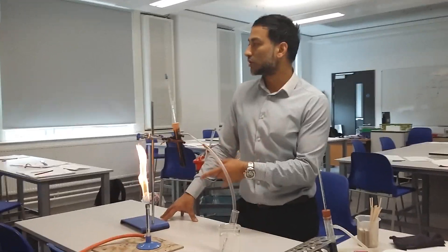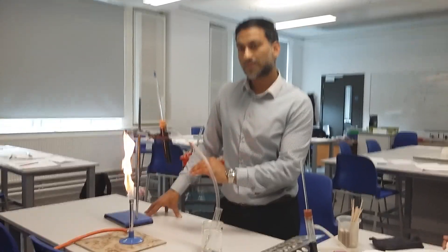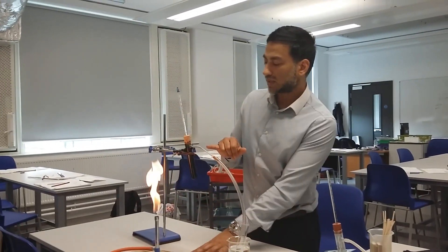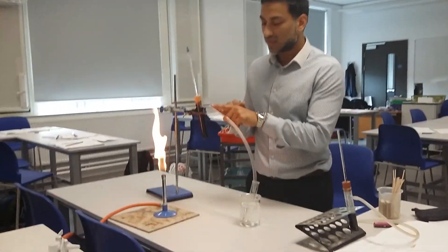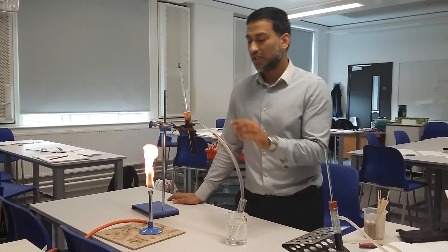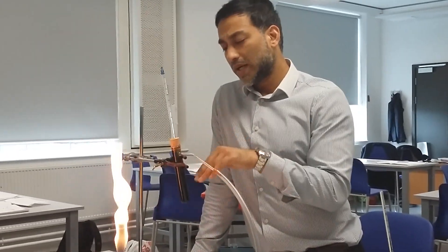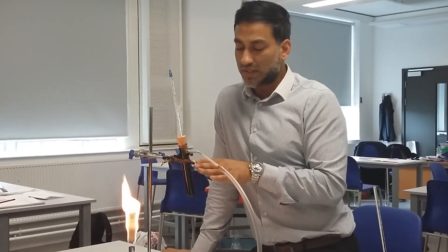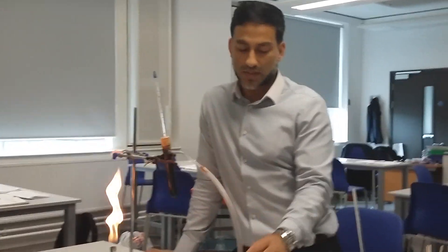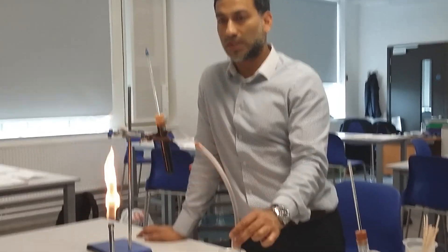The first part is we need to boil it so it reaches boiling point and above. Then we allow it to cool down by condensing. What I've got here is a very cold tube that was in the fridge, so as soon as the substance boils and the vapour goes up, it will start condensing back and collecting over here — the oil won't go in there, it's going to collect in here.